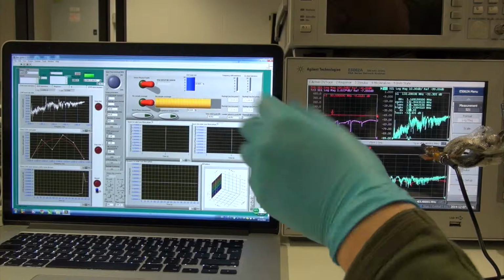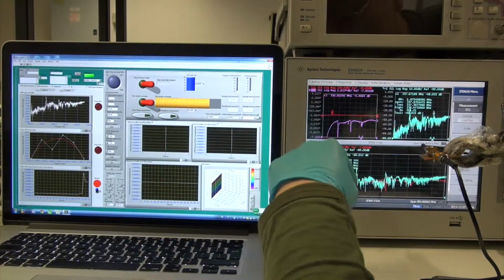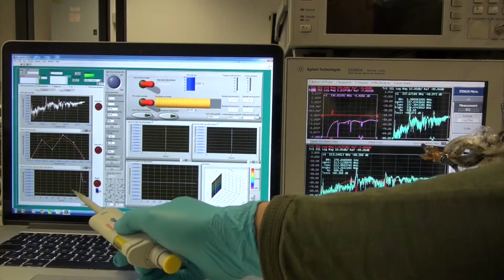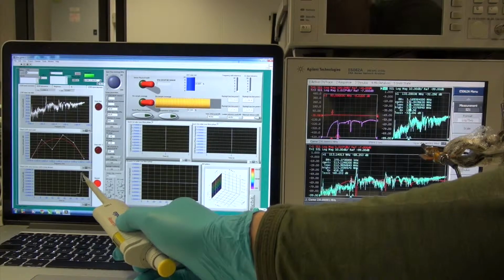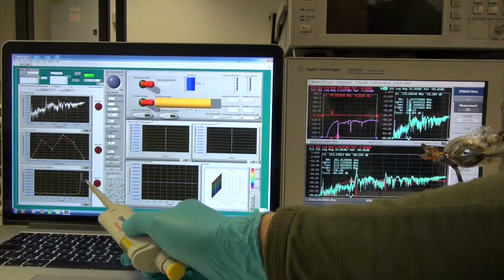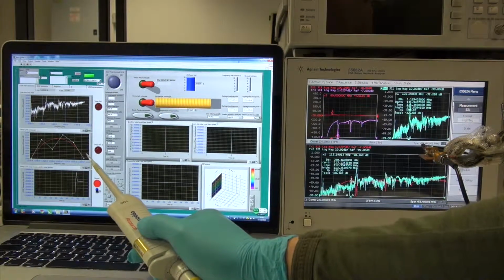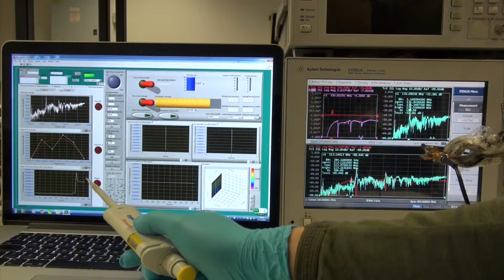So we use the Love wave for measuring the antigen-antibody in the liquid rather than the Rayleigh wave. We can see it from here. Since the Rayleigh wave disappeared, we can see the Love wave is still doing the measurement. You can see the orange position is here. Now this peak is actually caused by the temperature change, but very quickly it recovered to the real measurement signal. We can see it here. So this step from here to here shows the surface mass change of the device, which is, if we put an antigen and an antibody on it, it tells us how many antigens have been bonded to the antibody.